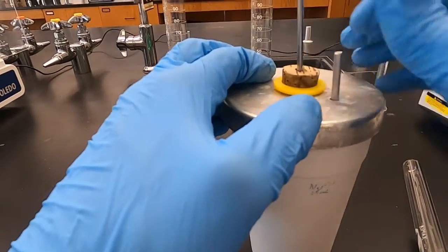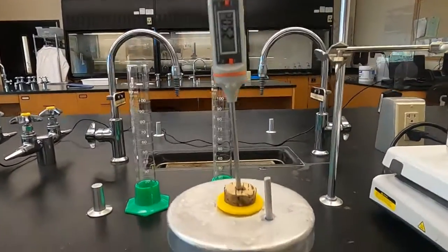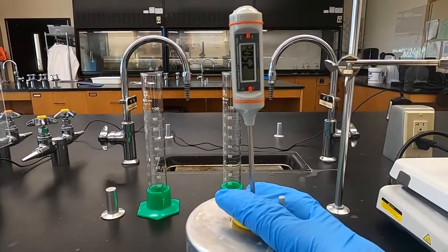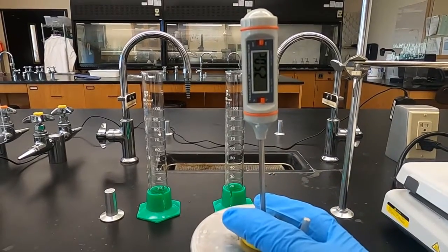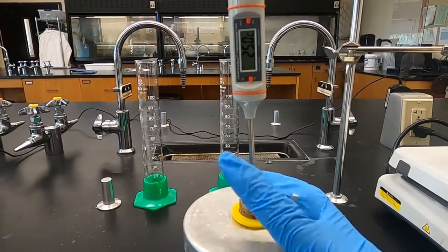Now I think it jumped up to 27 because it touched the metal. We just want to know what the water temperature is, so it wouldn't have jumped down that quickly just from mixing or not keeping an eye on that temperature. So I'm fine with this being about 25. Might gain a little bit more, but it's probably about stabilized now.